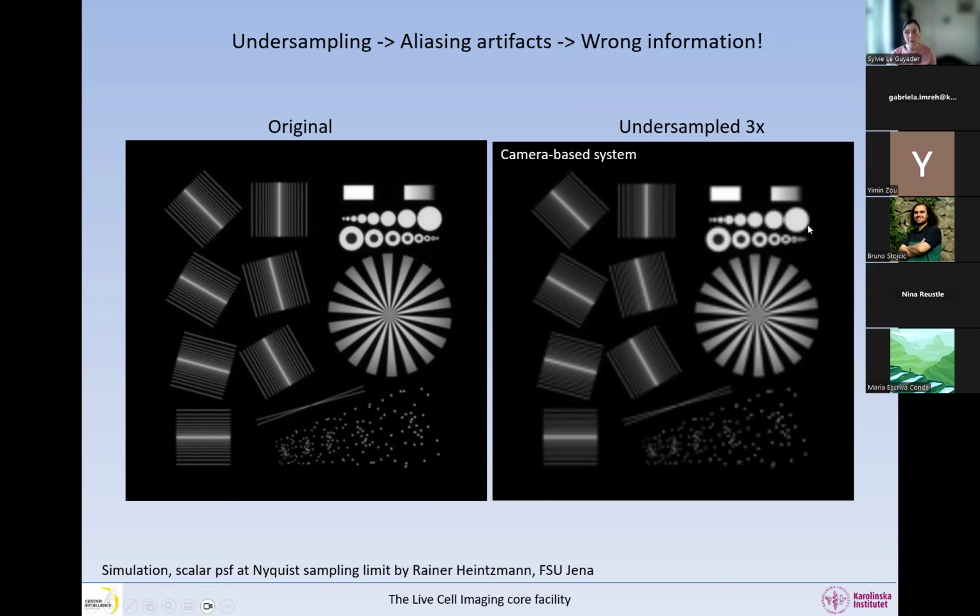But if you look at the patterns that are not regular, like here, for example, we're losing part of the resolution that we have here, and we do not see the hole inside. And then when we look here at the center, we also have very strange artifacts. This one here is also a little bit bizarre. But when we look at the image of the small dots, here we have artifacts like this, and then this one, I spoke about this already.